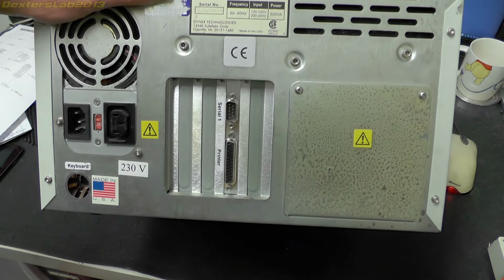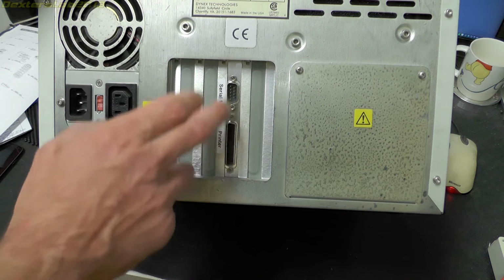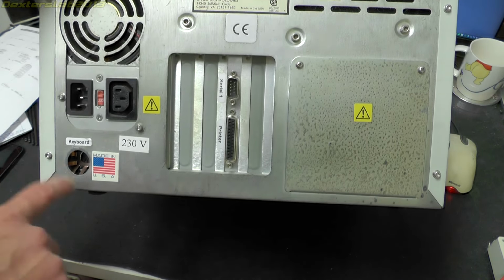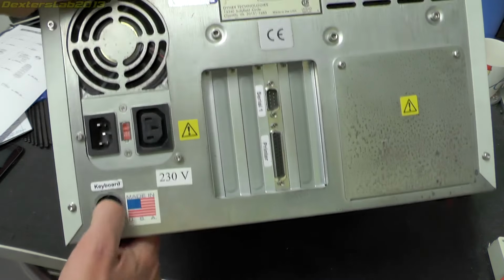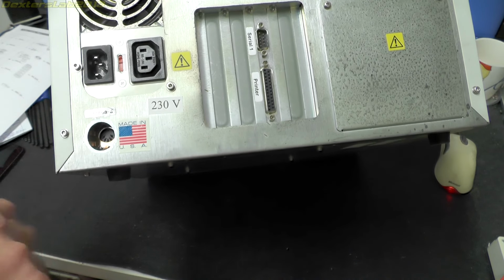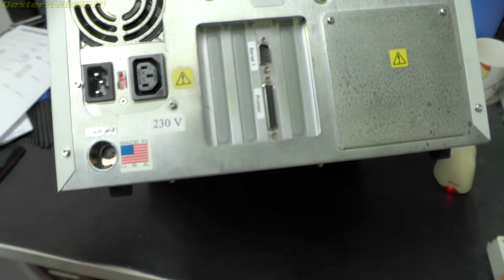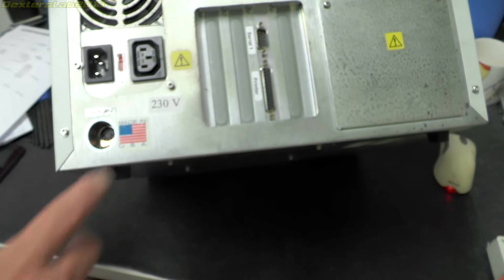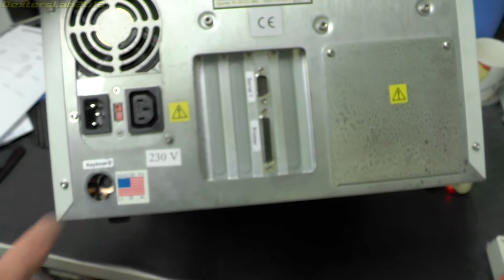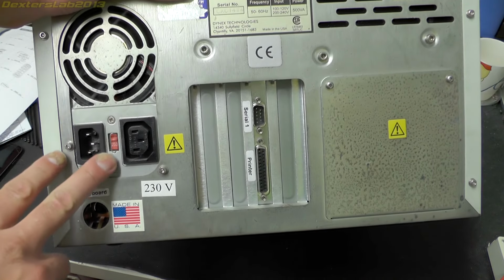So if we have a look at the back, we've got power input. We have a keyboard label there, serial 1 and printer, and for those of you who are old enough, you might start to recognise some of the layout here. We've got inside there an old school 5-pin DIN, and with that location and these card slots here, this is going to be an old school AT style motherboard. So this is effectively a PC, and another giveaway is the typical outline of a standard PC power supply.